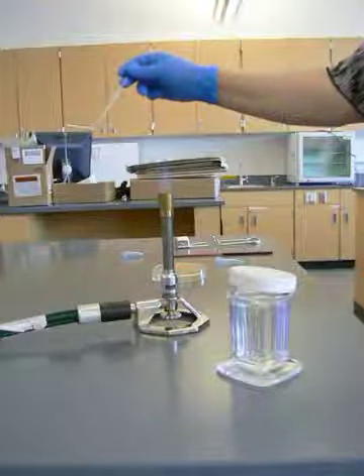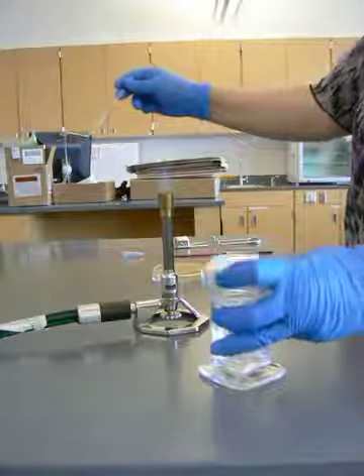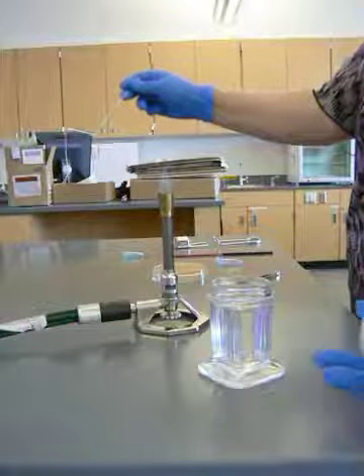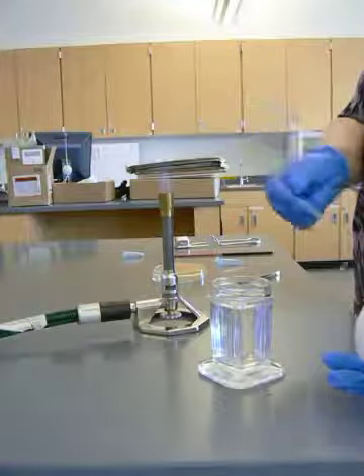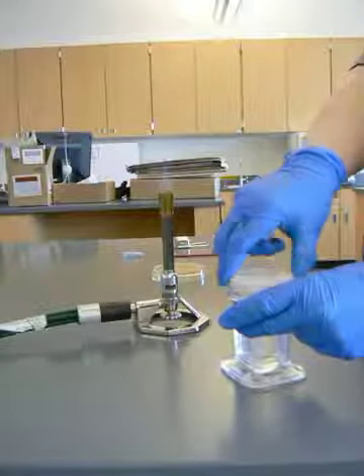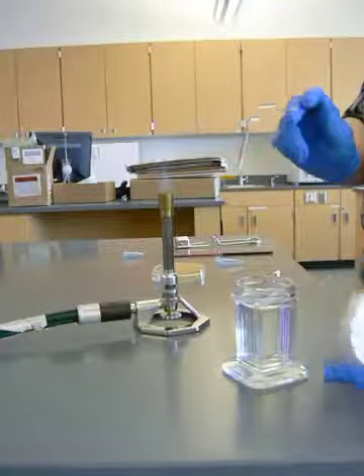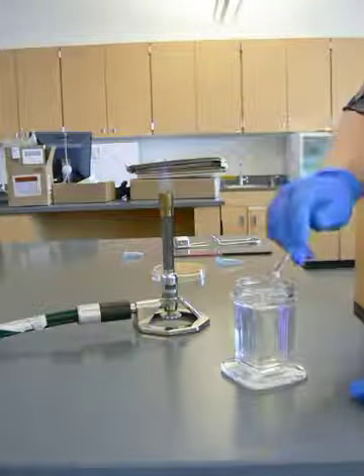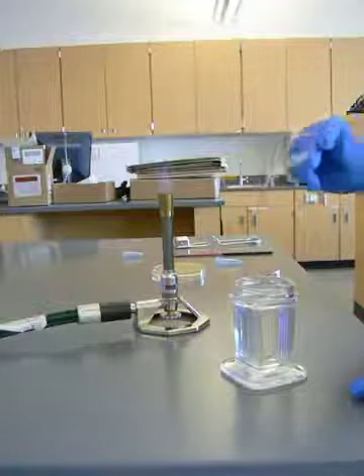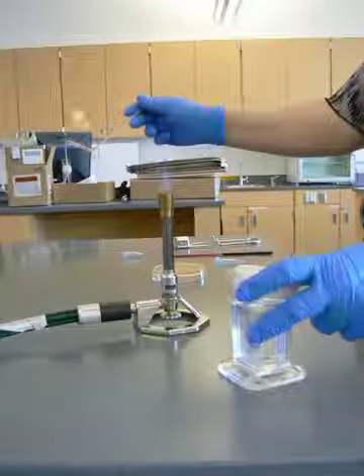I can see where it's burned. You'll notice that I put the lid back on the ethanol — the longer you leave the lid off, the more ethanol evaporates and you get a higher water concentration, so you want to put the lid back on. You'll notice that I was really quick. I want to keep as much ethanol on here as possible. You don't want to shake off the ethanol. You go in, you go over, you come out.